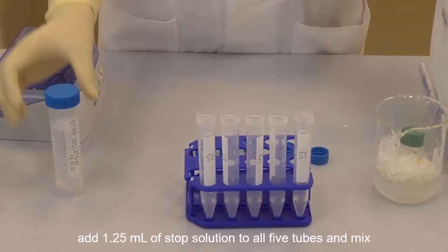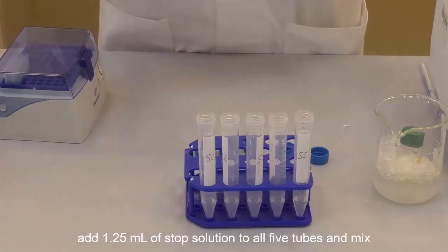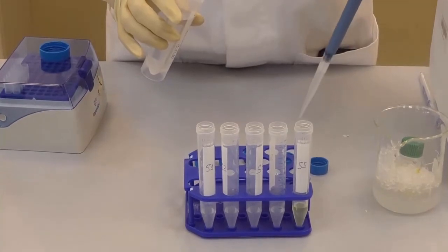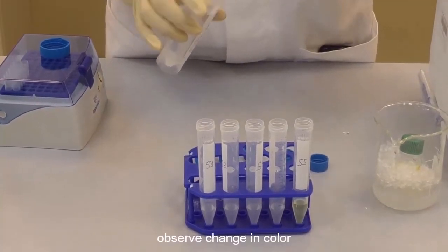Add 1.25 ml of stop solution to all 5 tubes and mix. Observe the change in color.